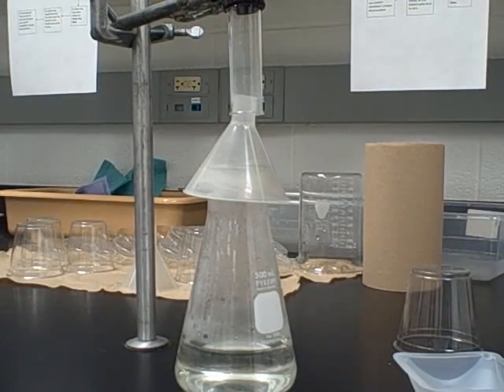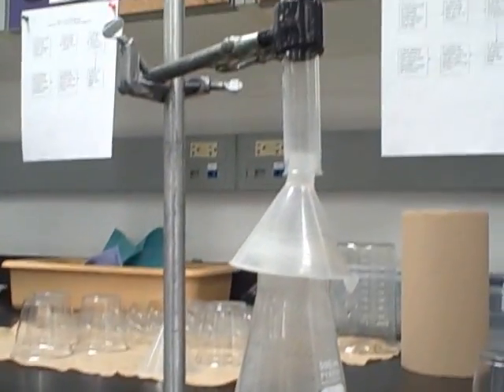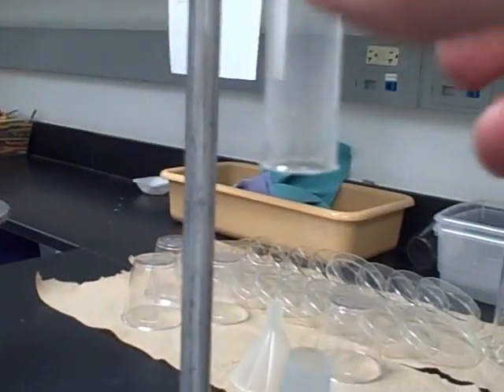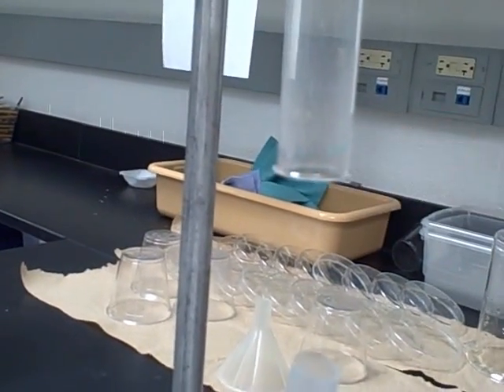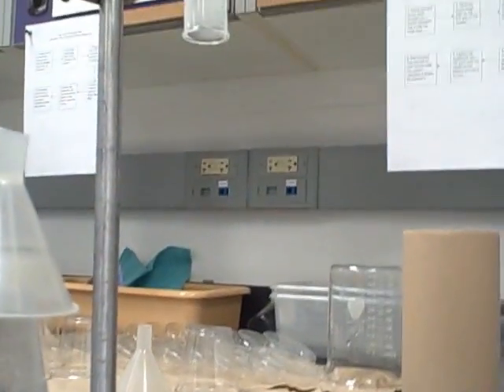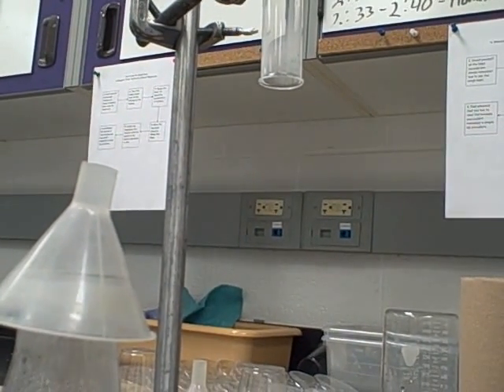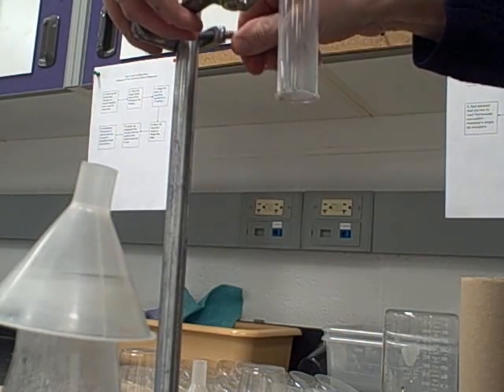We're basically testing your ability to carry out a chemical reaction. It looks like our fizzing has stopped. You can see some condensation from the heat and water vapor present from the hydrochloric acid. Now very carefully slide your test tube up to get access to it — about that high. Make sure you don't touch the test tube or allow it to turn over, because then the gas would escape. Slide it to the side, and now we do the standard test for hydrogen gas.